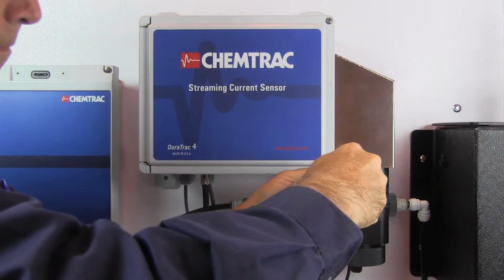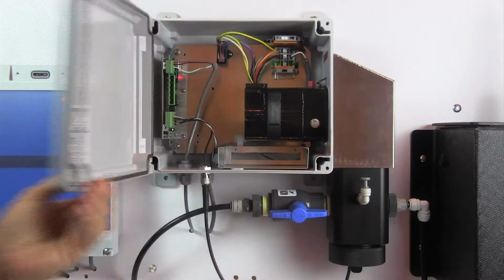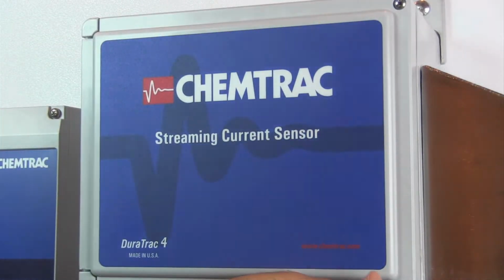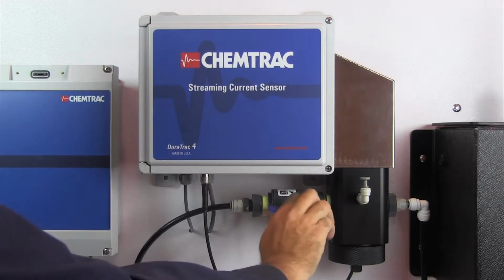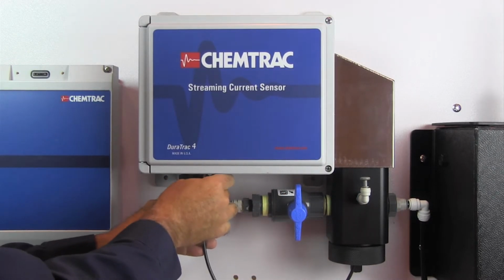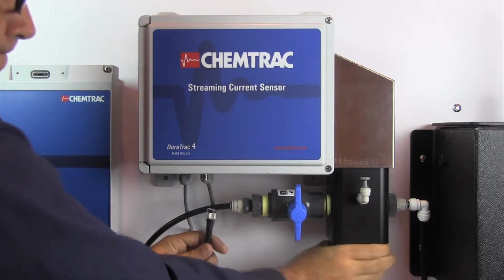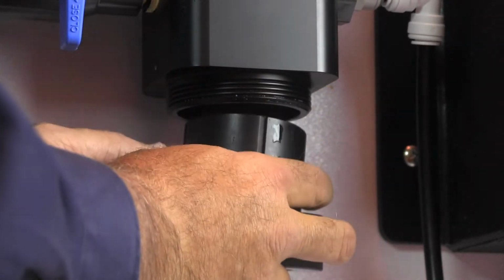When replacing the probe sleeve on the DuraTrac 4 sensor, the unit should first be powered down, either using the internal breaker switch or by unplugging the power cord. Next, stop the sample flow and disconnect the probe cable. Remove the sensor block probe retainer nut by hand, allowing the probe cartridge to drop out.